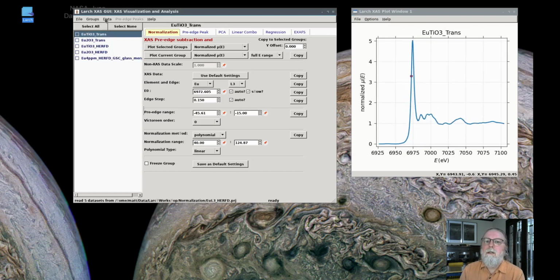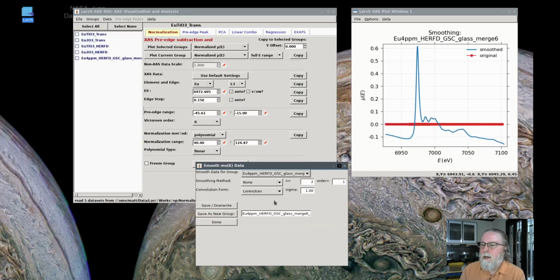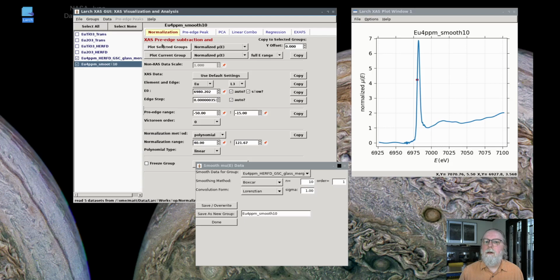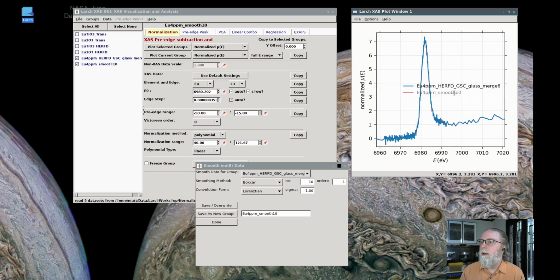So let's try that. From this data menu, there is a dialog to smooth data. So let's take this very messy data set for a glass, for an unknown, and there's a couple of different smoothing methods. One is to use a boxcar average to smooth the data. I can increase this to 10, and that will smooth the data a bit. Let's call this smooth 10. I'm just going to save that. And now if we plot those two together, that's the data and the smooth data. And in fact, you can see it didn't do much, except just make it cleaner. So that's a boxcar average.